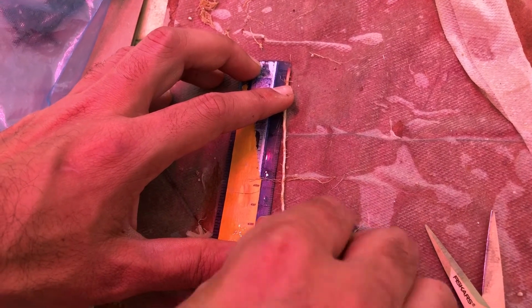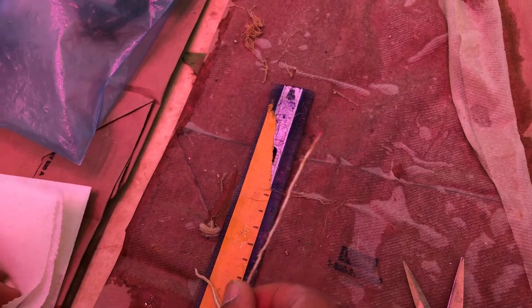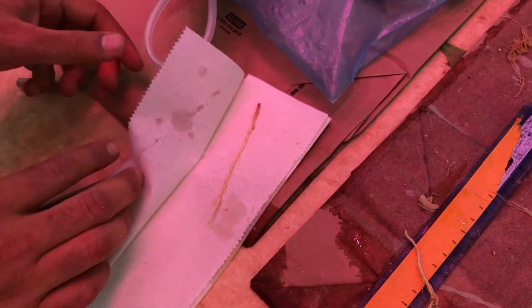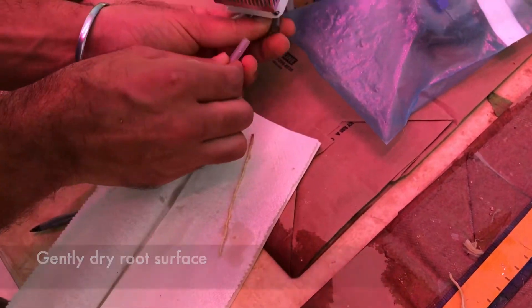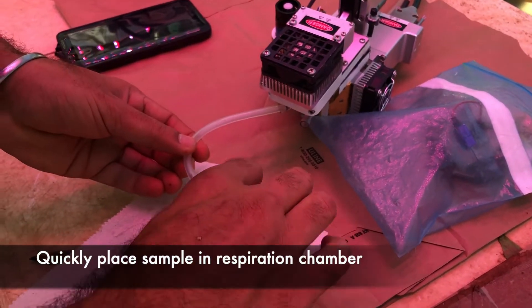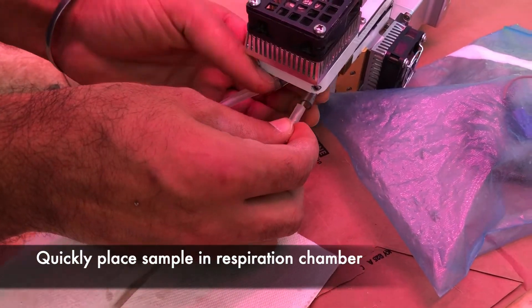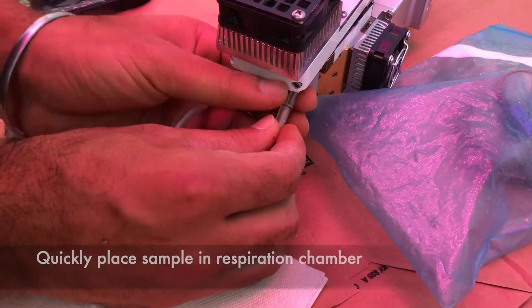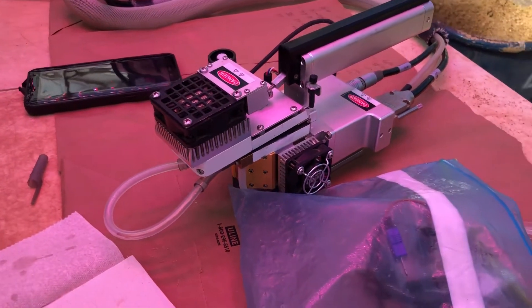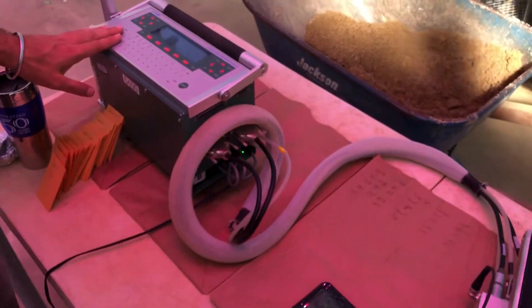We next select a known length of axial root for the measurement. For determination of respiration rate per unit length of root, noting the length of each sample is essential. Before placing the sample in the respiration chamber, we gently dry any water from the root surface. Although we don't want the root to desiccate during our measurement, a high humidity in the sample chamber can serve to absorb or release CO2 into the system, thereby confounding our measurements.